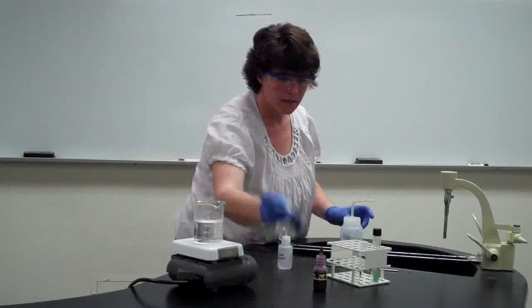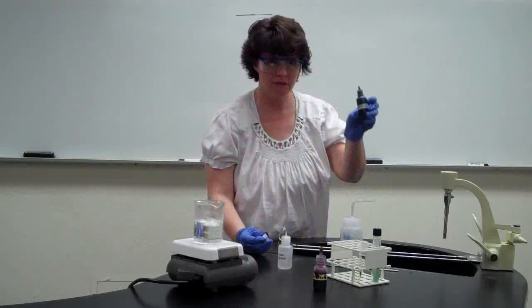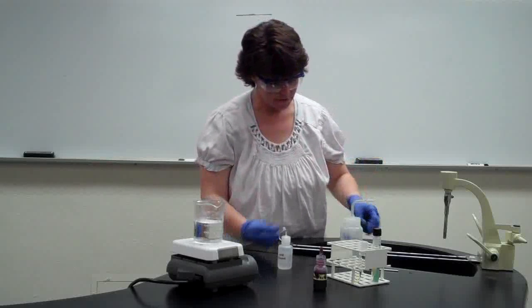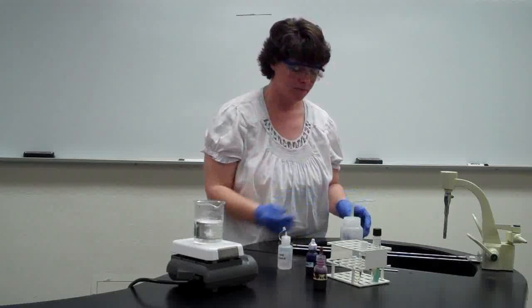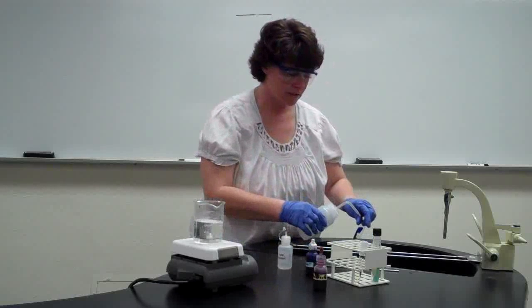Now we're going to use the secondary stain, which in this case is methylene blue, which you used in the first lab. Your simple smears. Your lab manual says to leave that on for 1 minute. You can go 1, but even up to 2 minutes with your counterstain. So after that's set for its 2 minutes, we're going to rinse it off.